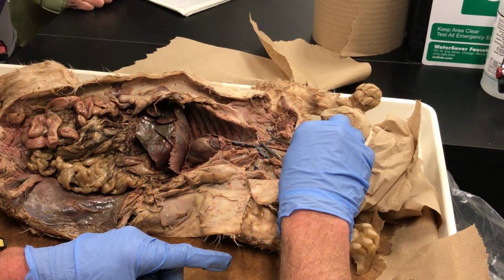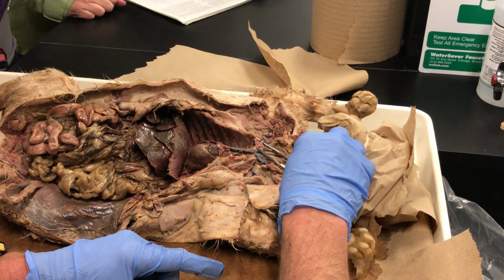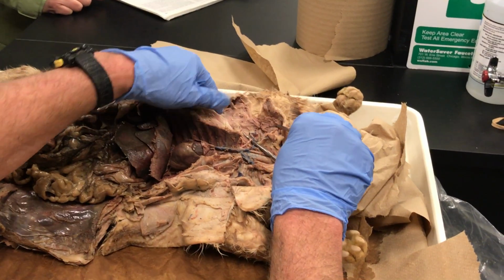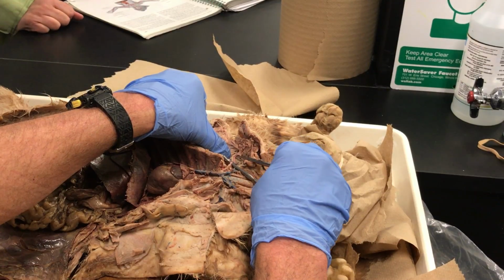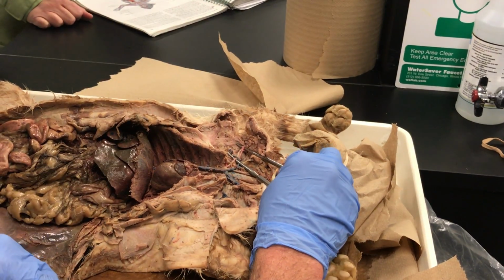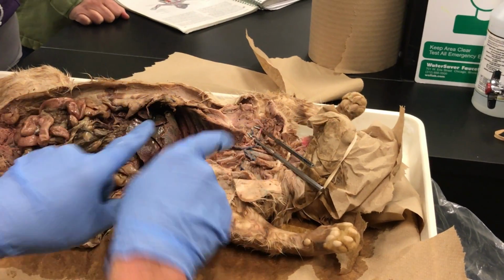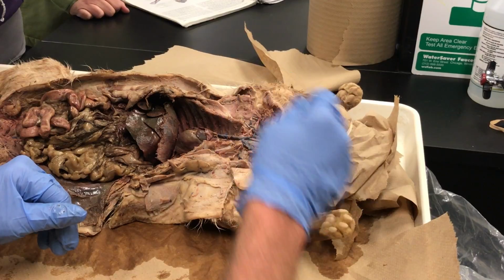As we get a little bit further along on that pink tube, it goes into the armpit area. The armpit area would be the axillary artery. And the furthest pink tube you can see out in the arm of the cat, way out there, that would be the brachial artery. And there are other little red tubes, arteries that branch off of it at different points, which is where you know where one starts and one stops. So there are three names for those vessels.